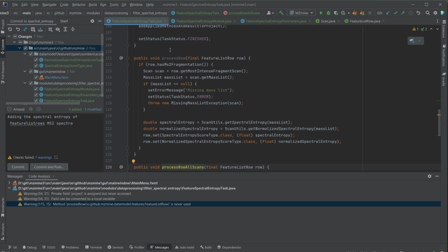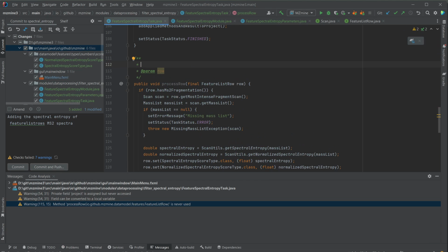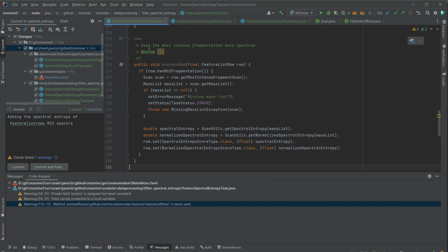We can still keep it in here, but honestly, we did a very bad job. We should have actually just given it some Java documentation. So just the slash and two stars is the Java documentation. And I can say: uses the most intense mass spectrum, fragmentation mass spectrum. And also for this one, I should also define some Javadoc usually.